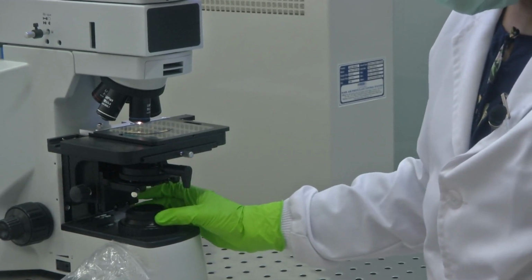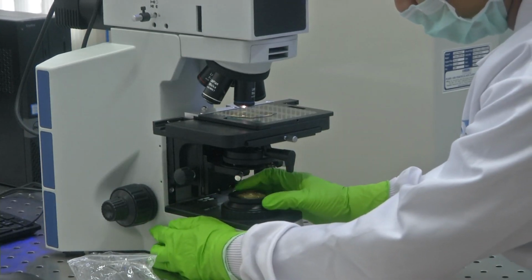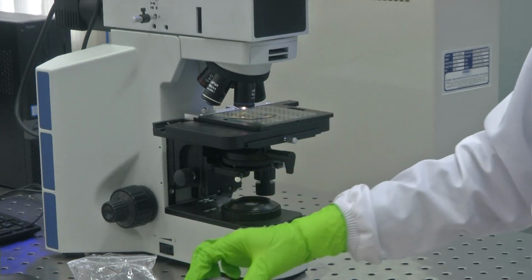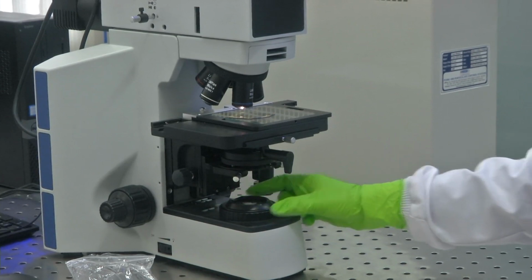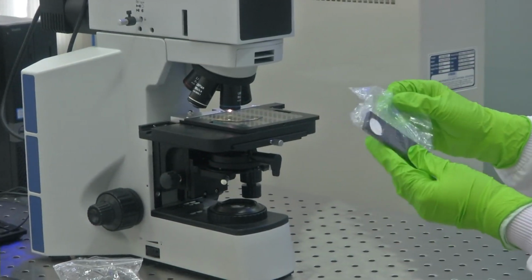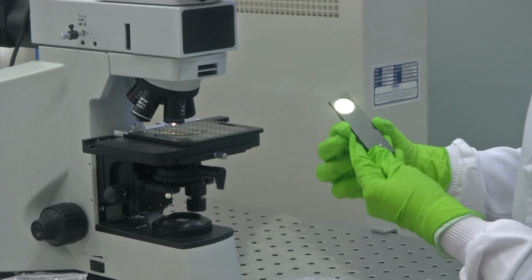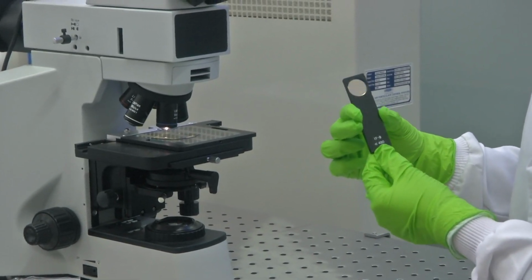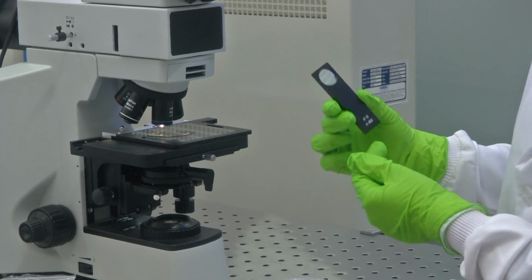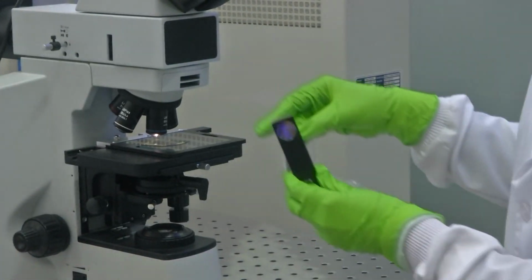So, you could change the, this more or less looks like the plain glass. So, the which can be put on this source, and let me show you the other filters. So, this is another filter which reads less than or equal to 480 nanometer. This is nothing but the wavelength, the effective wavelength for filtration. So, this is one such filter, and there are many other filters which could be adjusted in your slot.